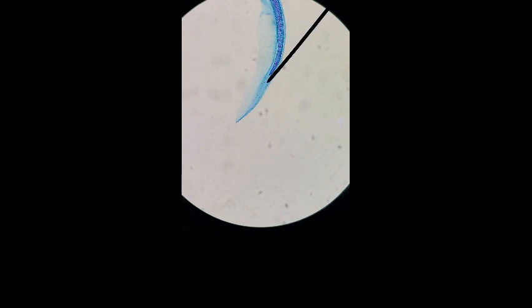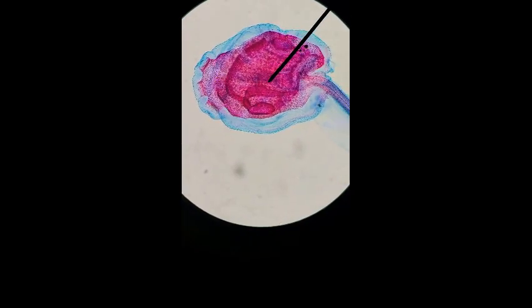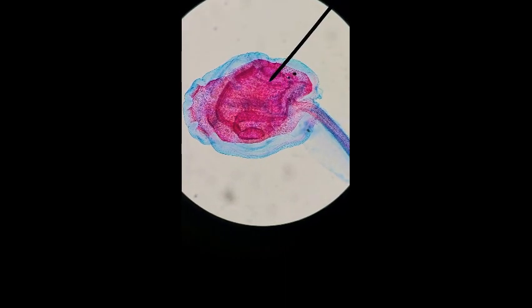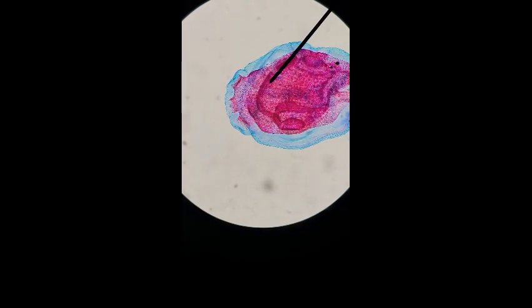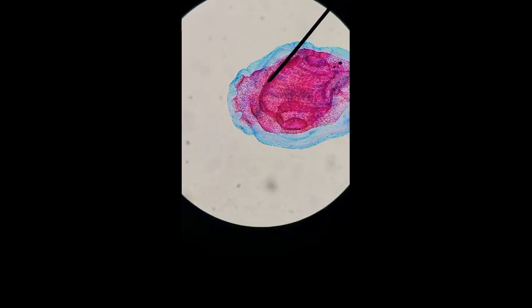We have the postanal tail, which is apparent here, that extends past the gut region. And we have our pharyngeal slits located in the pharynx region that appear as off-red spots. And this dark red structure over this way is our endostyle, which secretes iodine and mucus that traps food particles and is located along one side of the pharynx.